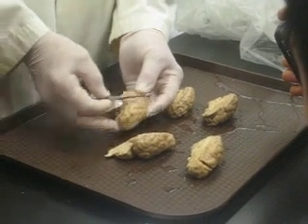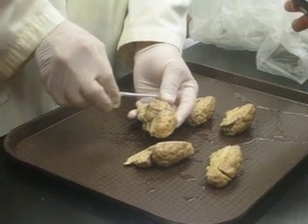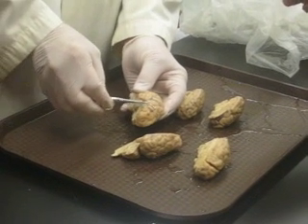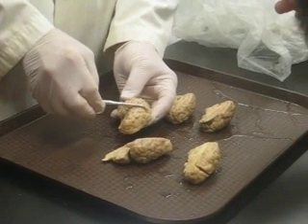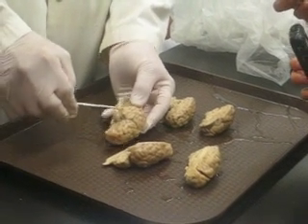So temporal you can kind of pick out. This one that comes around this way would be the temporal region or area. We're simply taking the cerebral cortex and dividing it up into frontal, the middle portion here we call parietal, the back portion would be occipital, and this temporal.